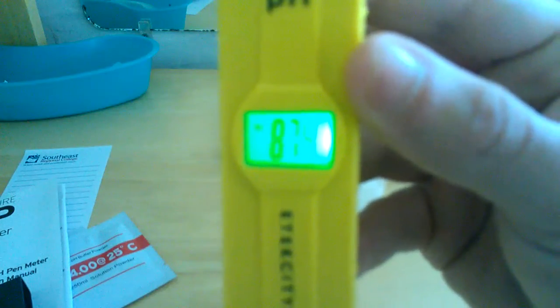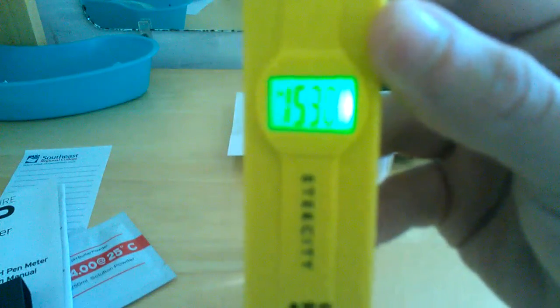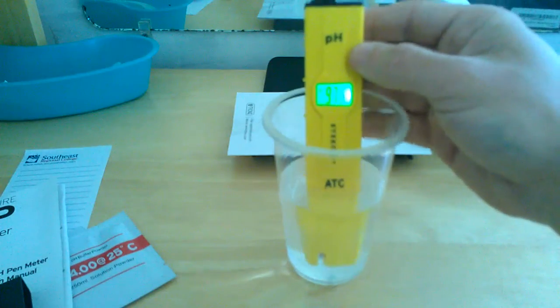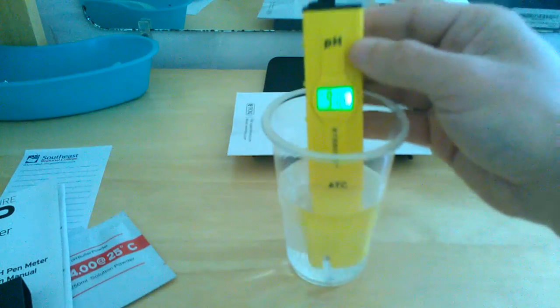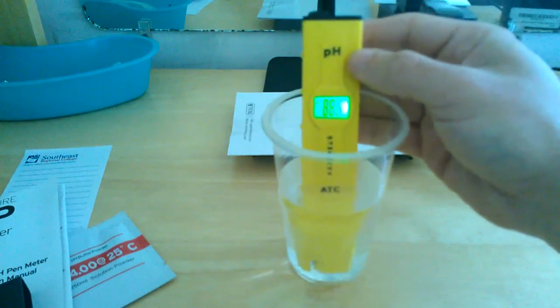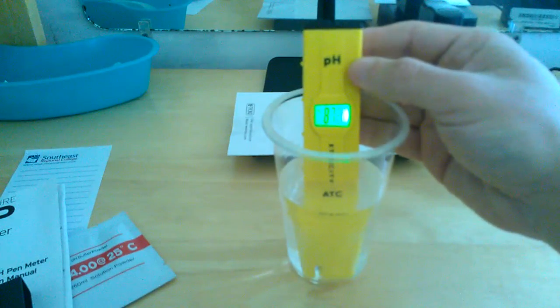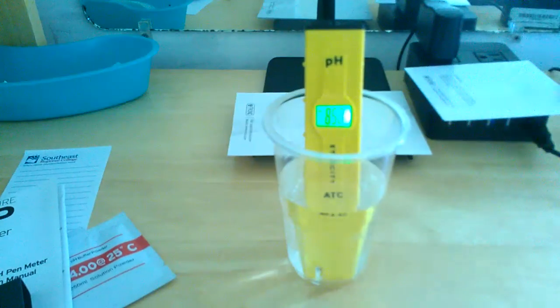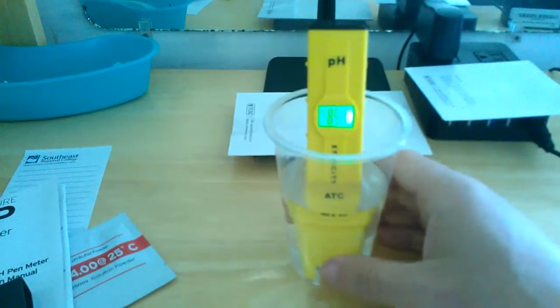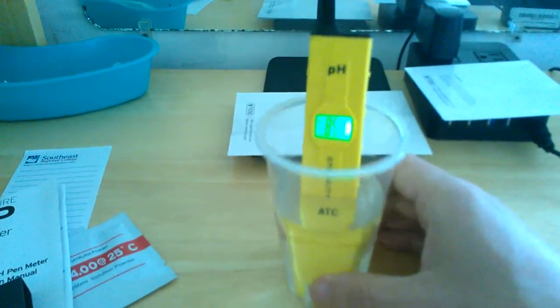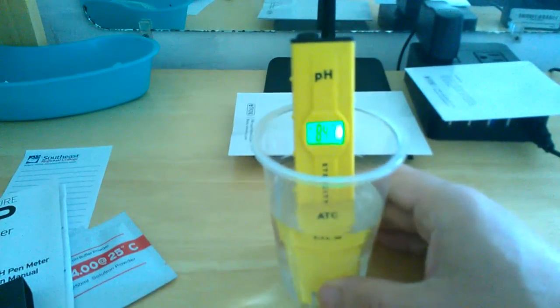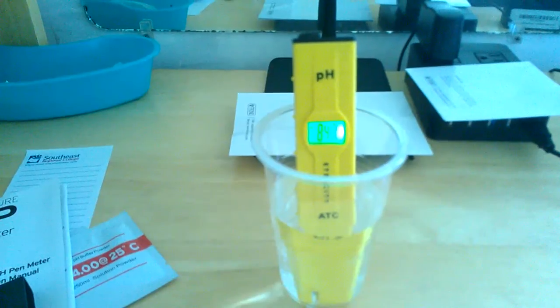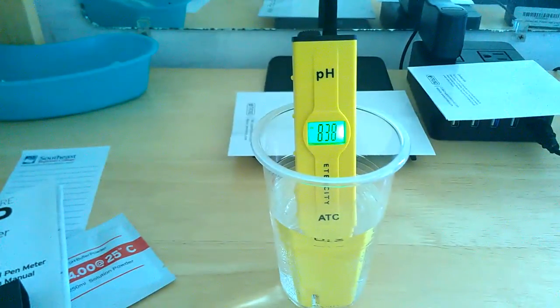And you simply just slide the button over on the top to the left. And it gives you a reading there. It's jumping around right now. It does until it stabilizes. You just submerge it into the water. I'm going to go a little bit deeper there. It shouldn't hurt it. Let's see if I can get this right for you guys so you can see what I'm getting here. And usually just wait a little while and let it stabilize.